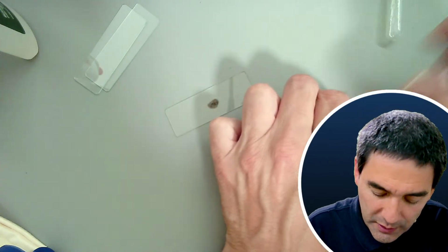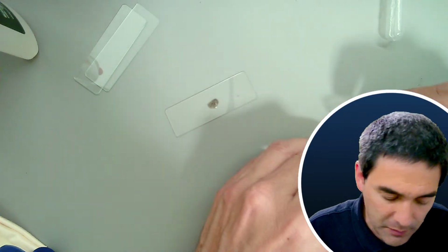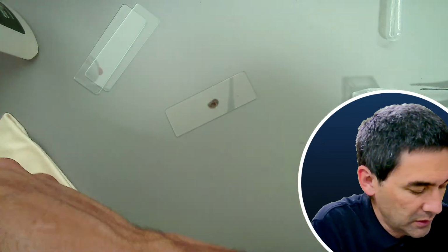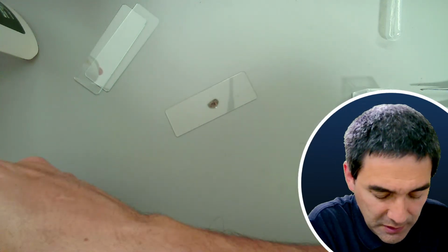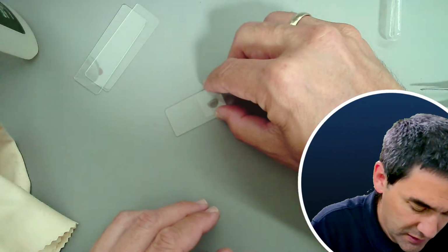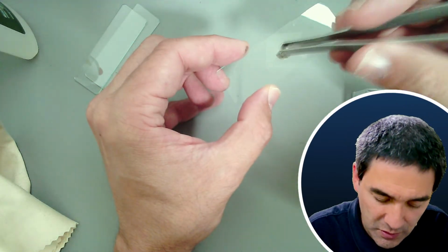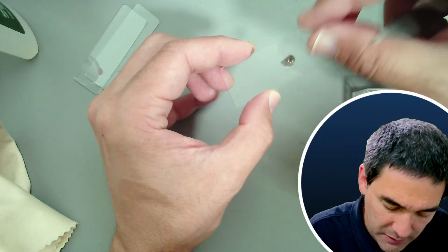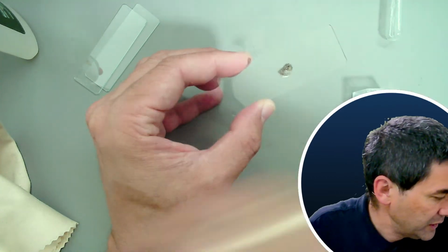Maybe we have to work at a low magnification, but sometimes we are able to see some small microorganisms between the sand grains. This is not a very suitable specimen. We have to knock it apart a little bit. It's way too big, so I need to remove some of the larger pieces here.